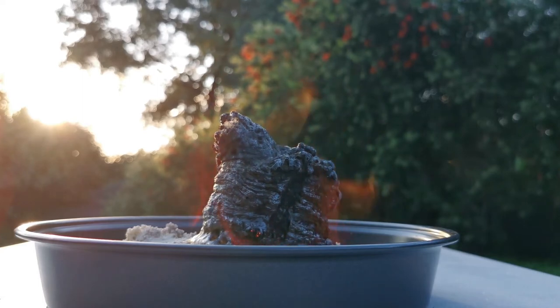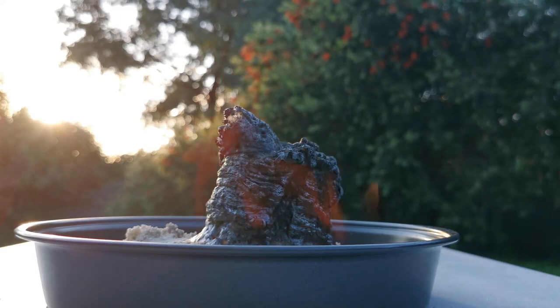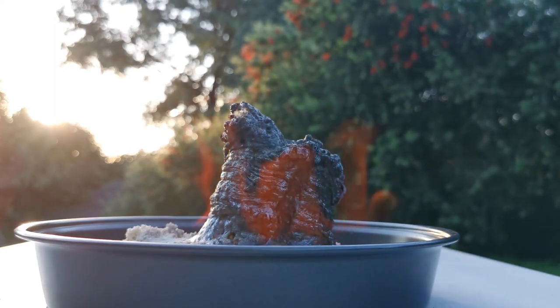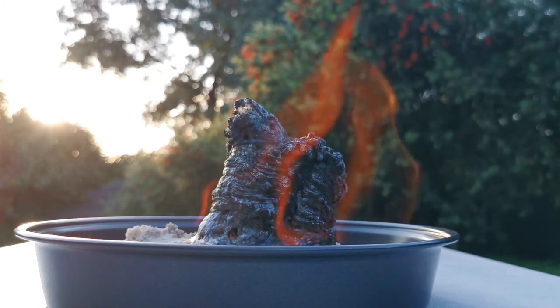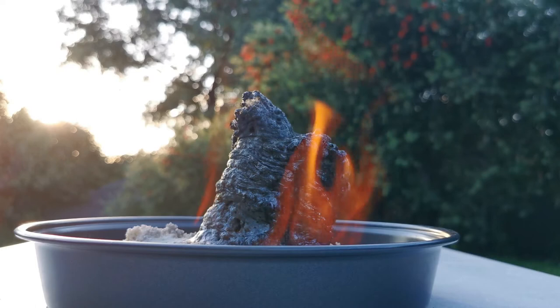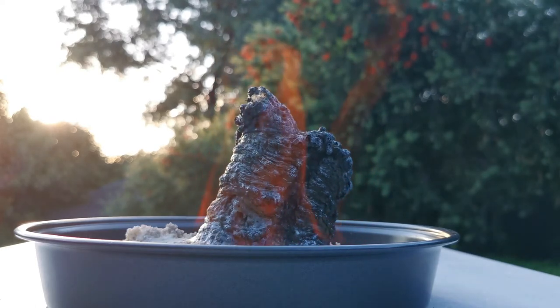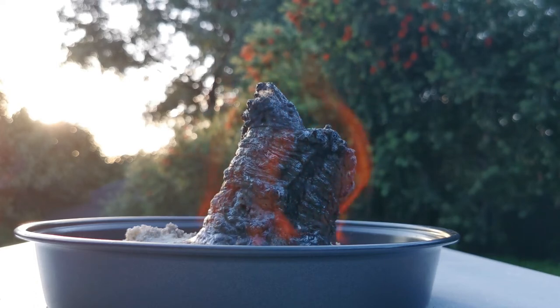The column is actually starting to grow up now. This is a better one if you want to come and see. Alright, stand back here behind me. That's it. See, this one's growing up out of the pile, isn't it?